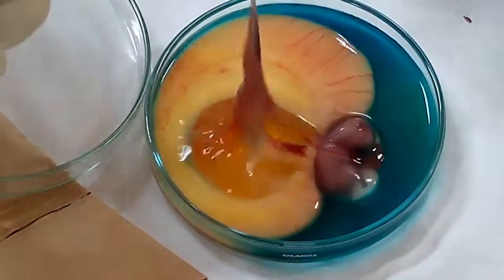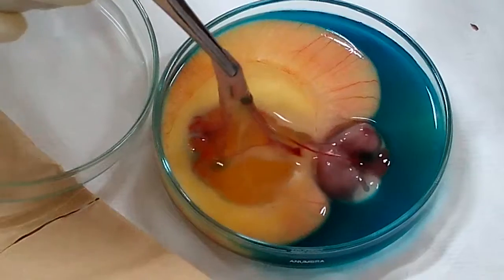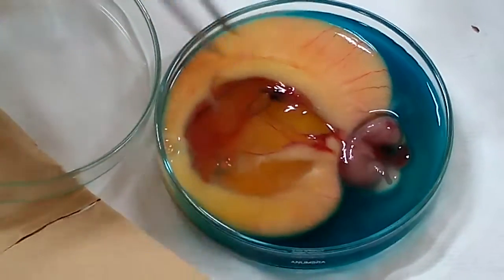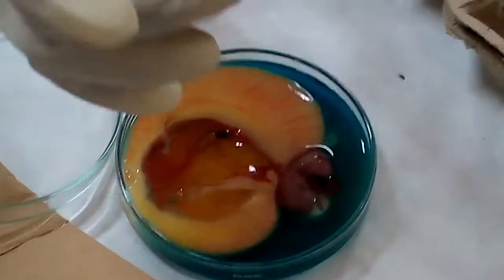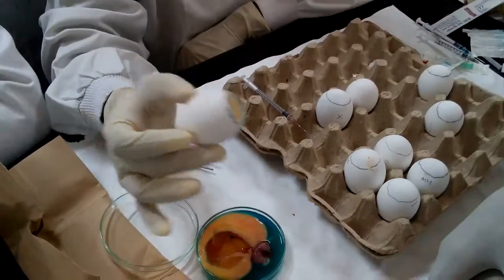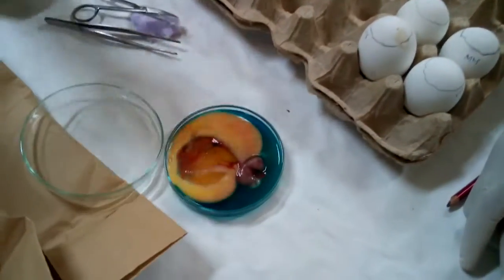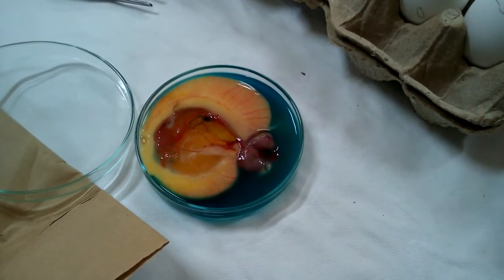You just cut it open — this whole membrane. You cut it open and you can use this as a source of virus antigen. So now there is nothing left. This is practically a dead shell which was just protecting the embryo. Once this is done, we discard this. We can try other routes.